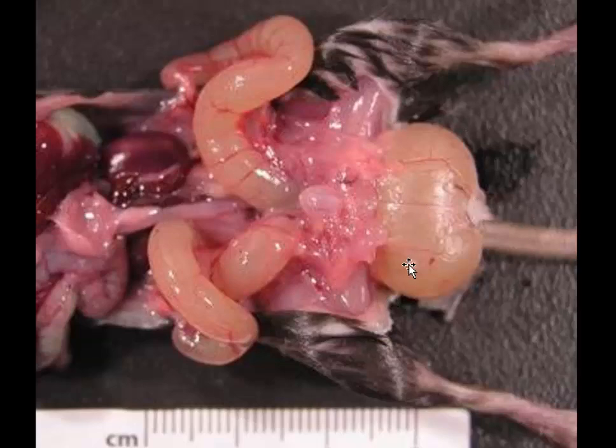It is extremely distended with fluid because this animal has an imperforate hymen. This is seen in a number of strains of mice, including C57 blacks. This is a black mouse. That all fits together very nicely because there is an imperforate hymen.